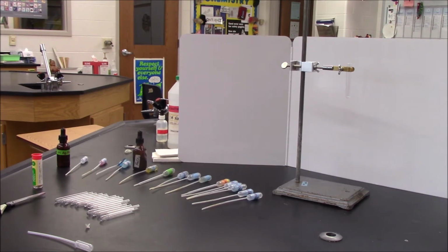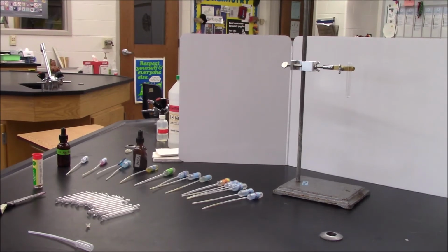All right, in this activity, all of these reactions are going to take place. We'll write down our general observation and identify what is formed. Generally, if we observe that the solution became cloudy or changed color, then we can say a solid formed. If we couldn't identify any changes, then a liquid most likely formed. I'm also going to use some litmus paper to help you see that the reaction takes place. If we see bubbles, that means a gas forms. At this point, we're ready to begin.